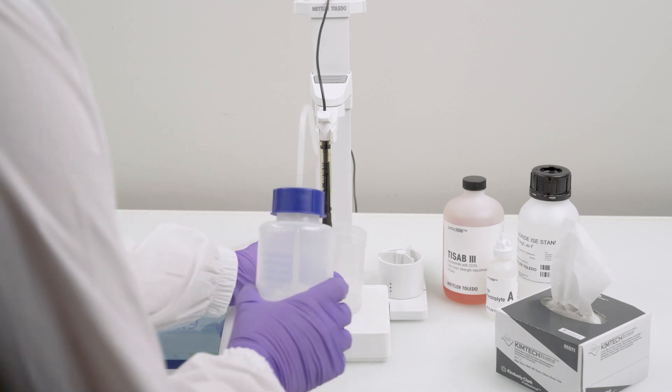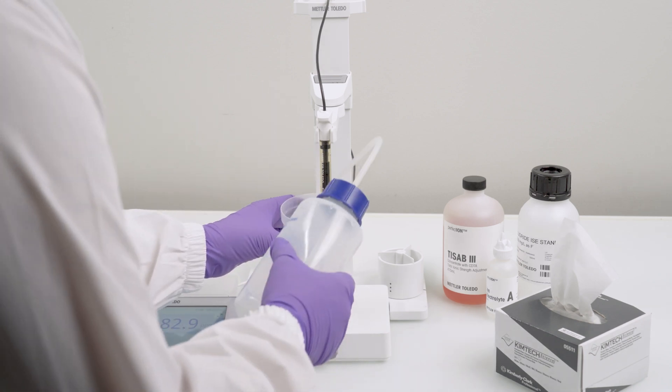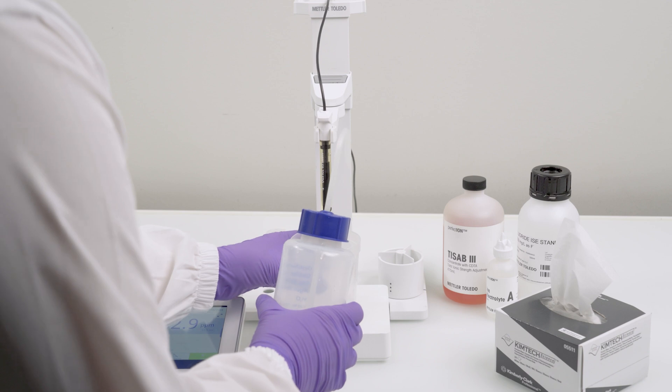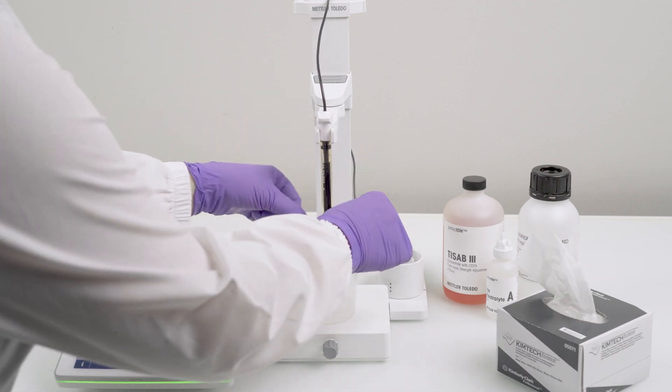Once the measurement is complete, clean the ISE sensor with distilled water and gently blot it dry using tissues.